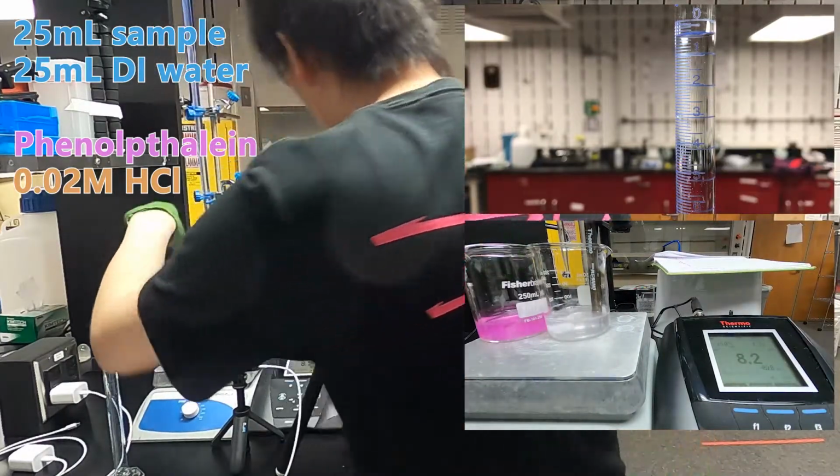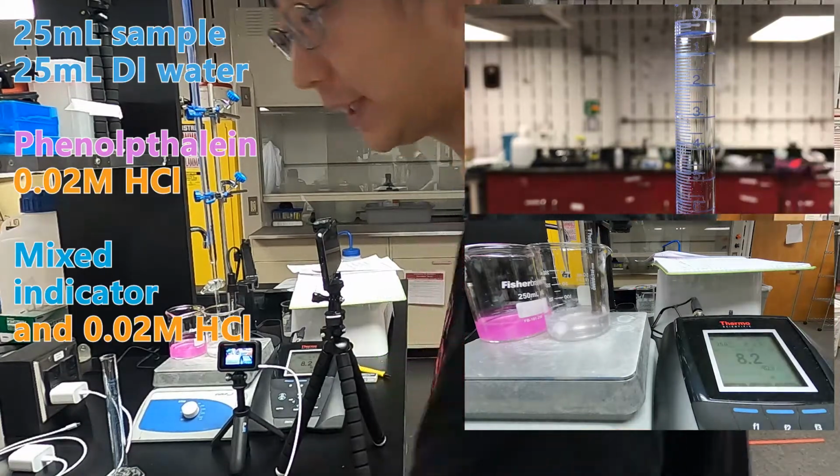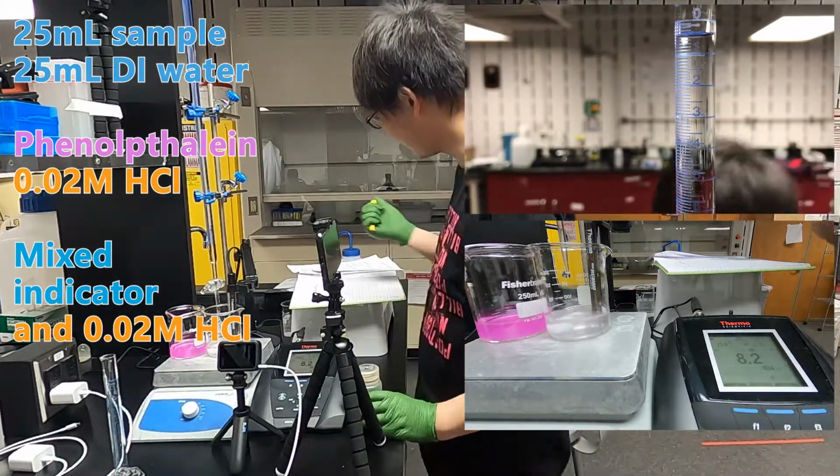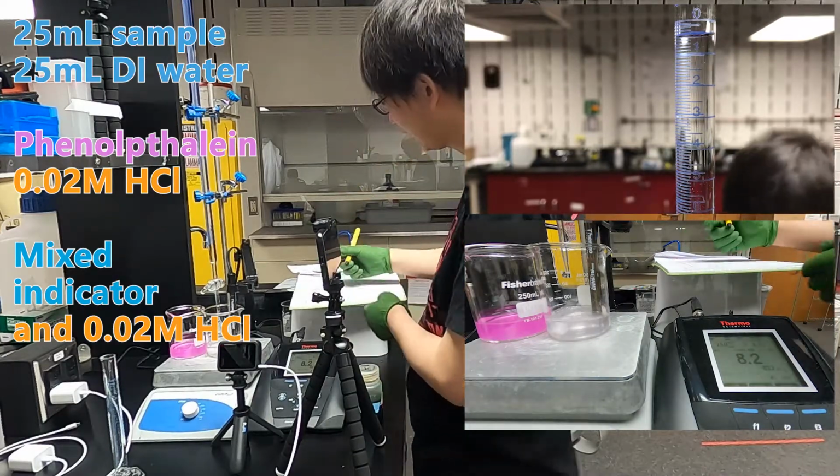When the color becomes completely transparent, then we add mixed indicator. And then we mark this color change point, which is around 0.5.